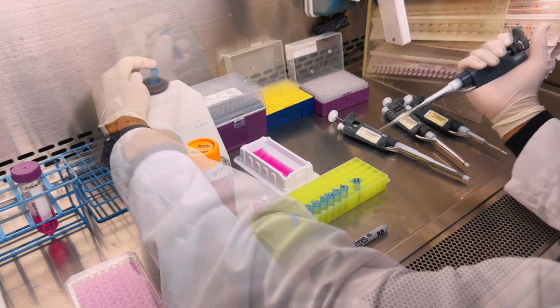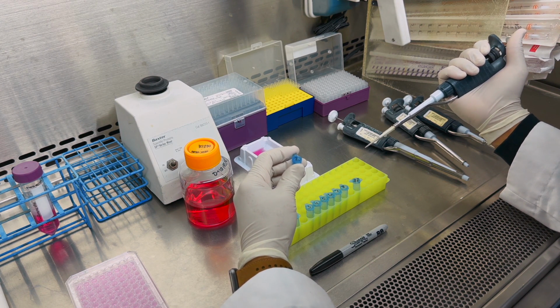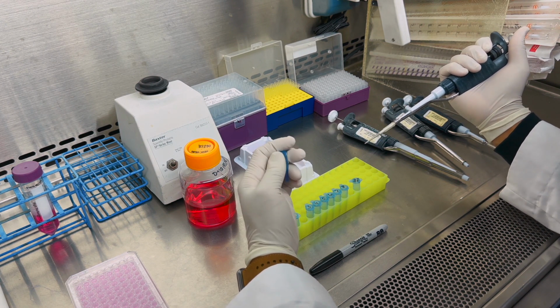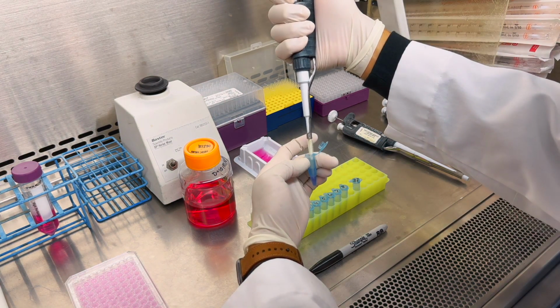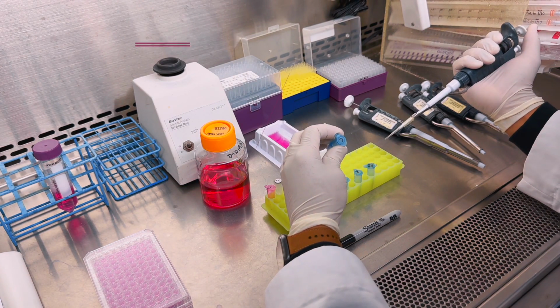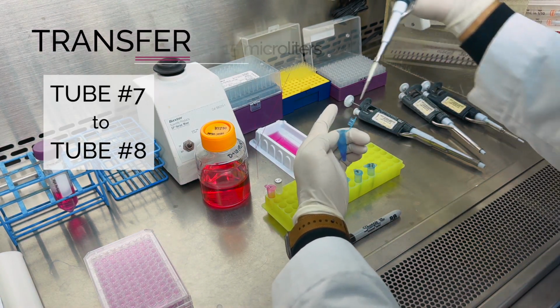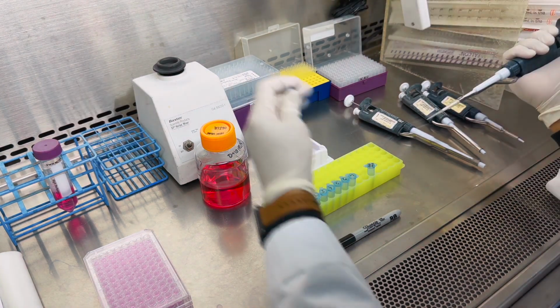Vortex briefly. Now, from tube number 2, you will transfer 15 microliters into tube number 3. Vortex briefly. And lastly, from tube number 7, you will transfer 15 microliters into tube number 8. Vortex briefly.